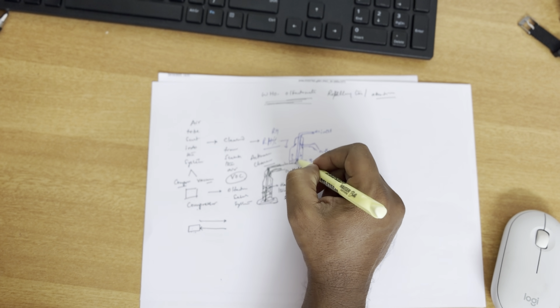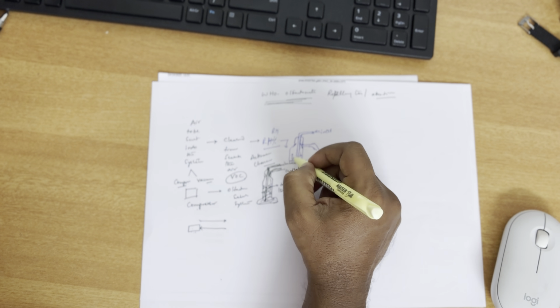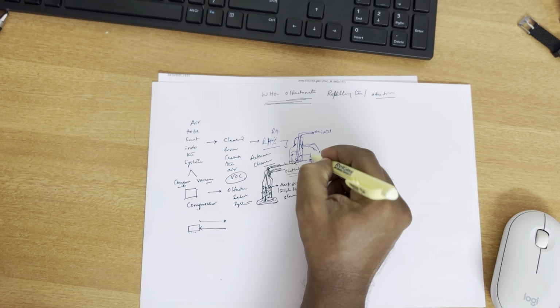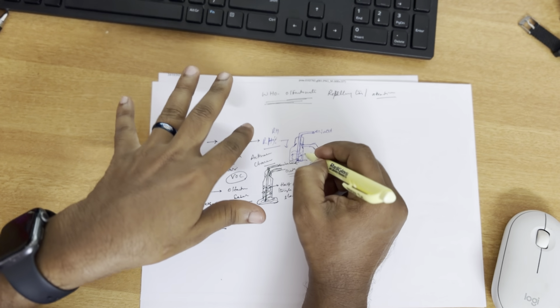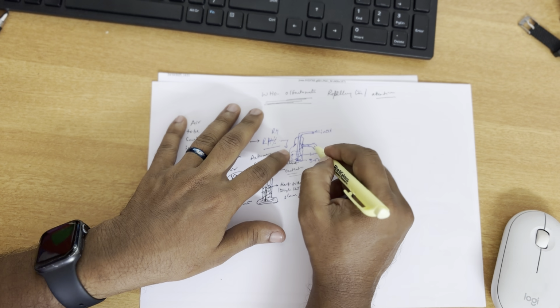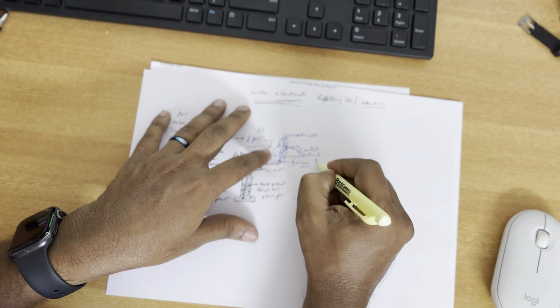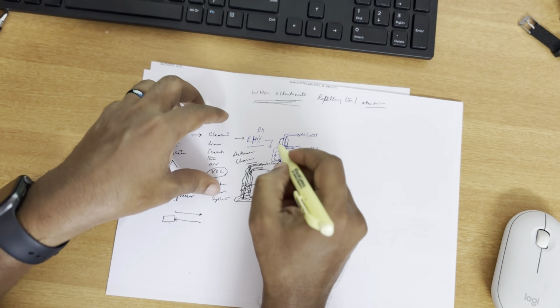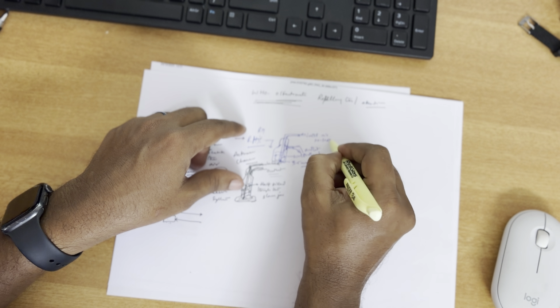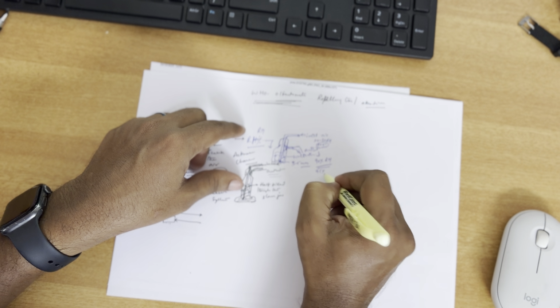The air will go through this gap and fill the chamber, so that if it is filled with charcoal, the air gets purified. If the chamber is filled with water, the inlet air picks up moisture, and the moistened air comes out as the outlet here. Moistened air is almost 90% RH. If you give inlet air that has 20 to 30 RH, or maybe 40 to 50, it can saturate up to 90 to 95% RH.